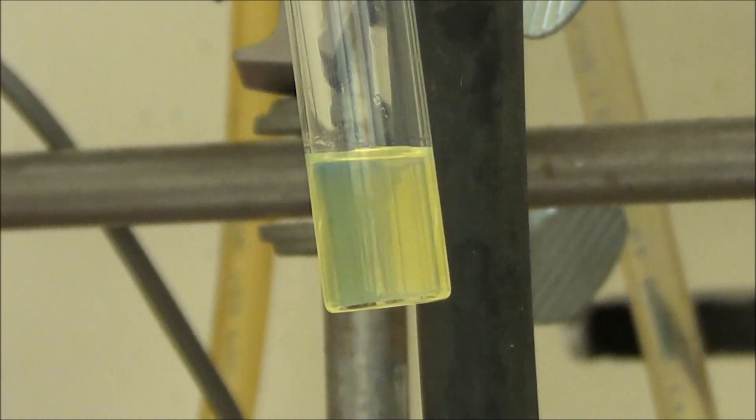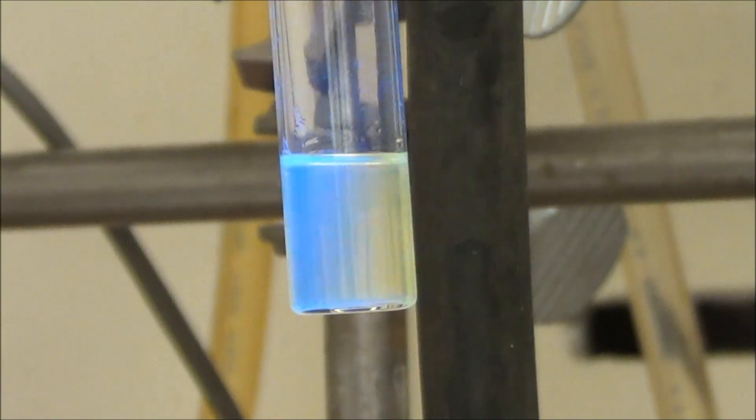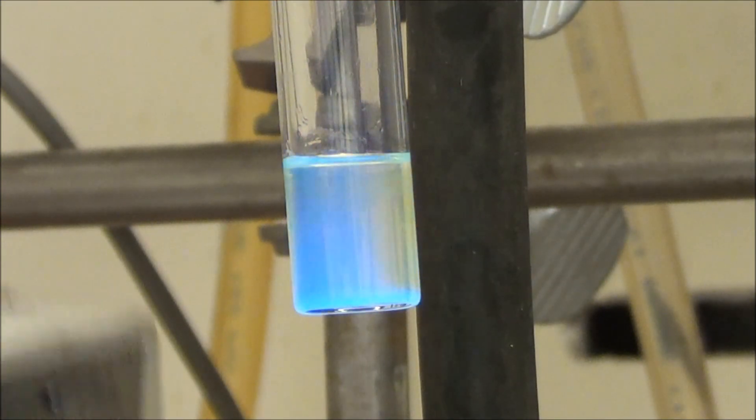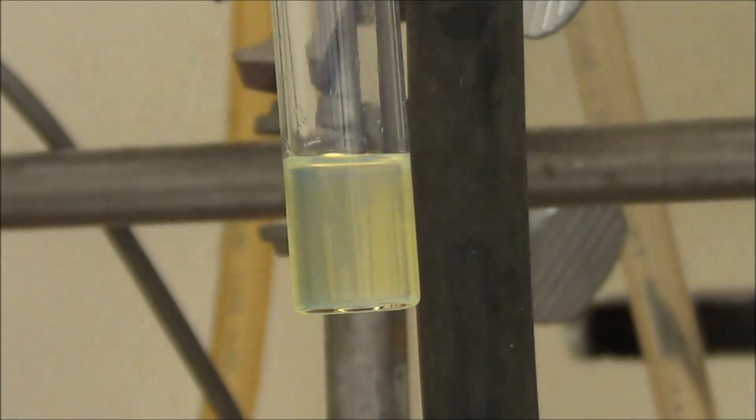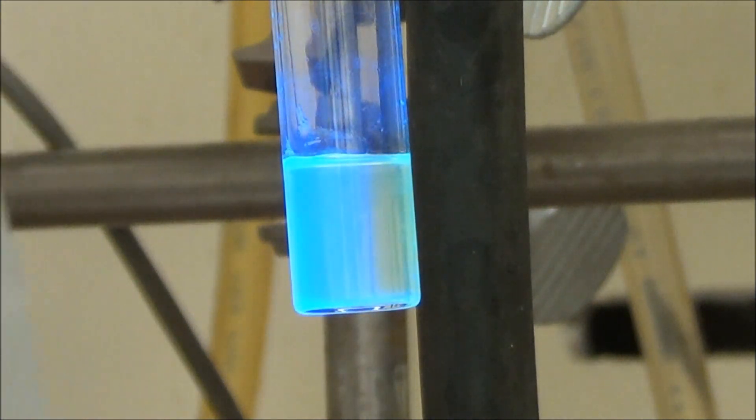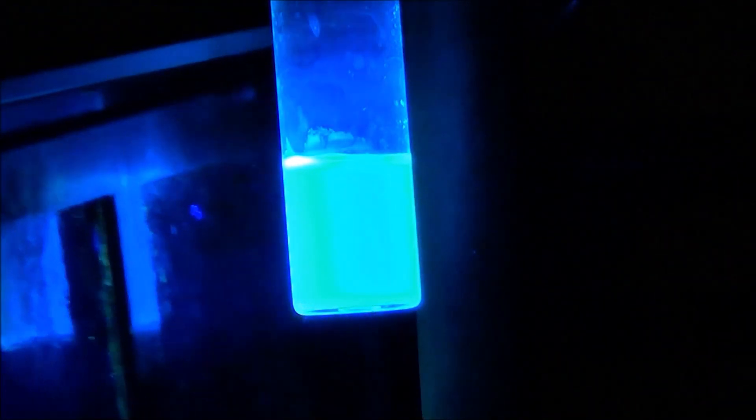Now to prevent that from happening, I just tap on it, I keep tapping on it, and I do that kind of obsessively for the first few moments until all the air has come out of the solvent. After that, you should be safe, and it'll dry normally, and of course I like to check that it's still nice and bright, which of course it still is.